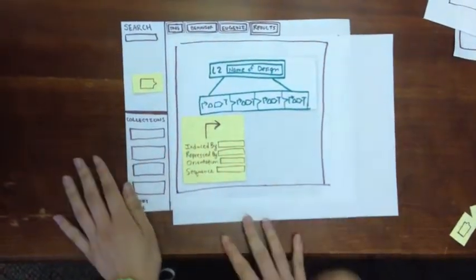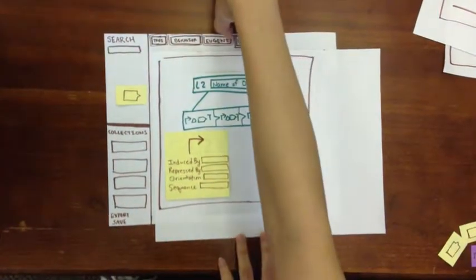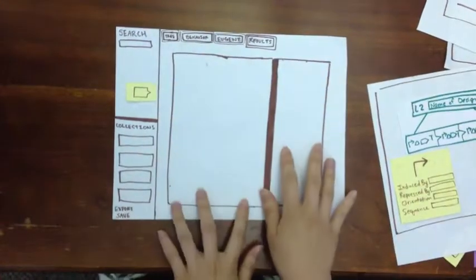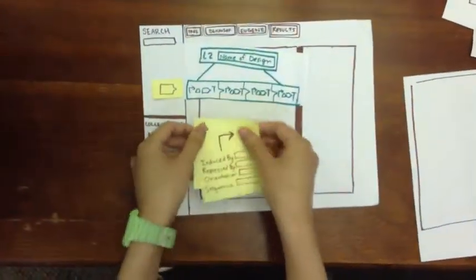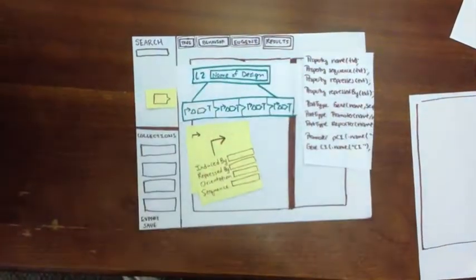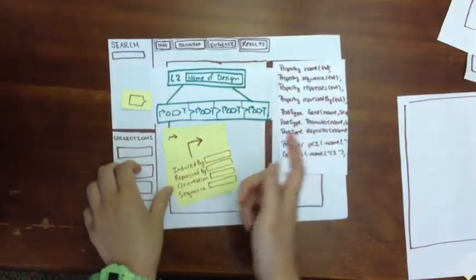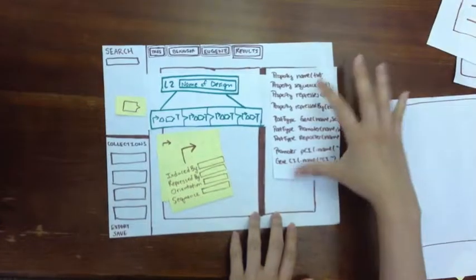So here is just the tree view, but we can also view behavior or the Eugene code behind this tree. So for now, let's see what it looks like when we highlight Eugene and tree view. So a multi-pane view will appear, and you have your tree on the left side and Eugene code on the right. So this is the view when tree and Eugene are highlighted. Within this view, when you add to the tree, the Eugene code live updates. So for example, you define your promoter with specific properties, the Eugene code will update to have the promoter with those properties.